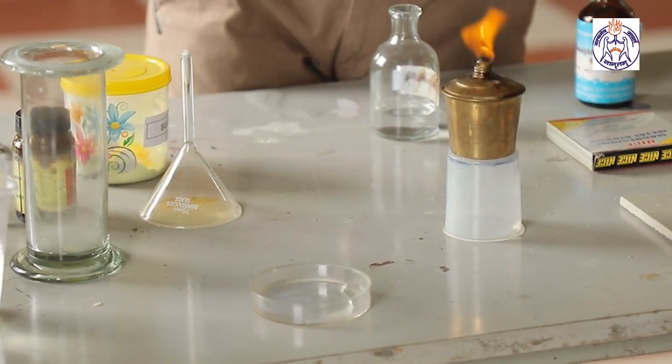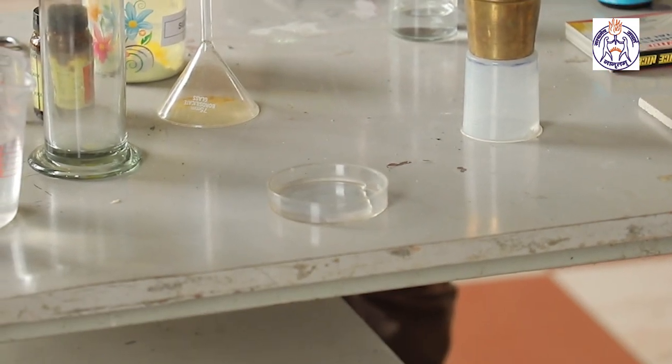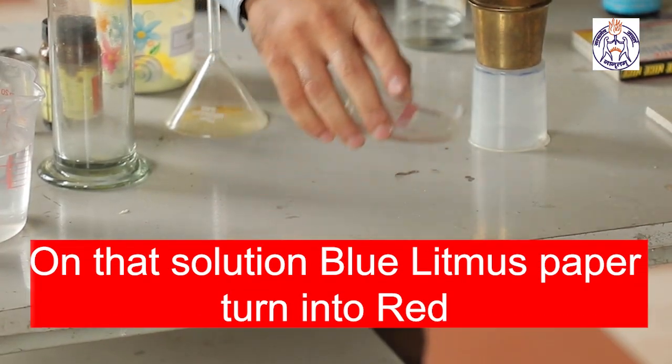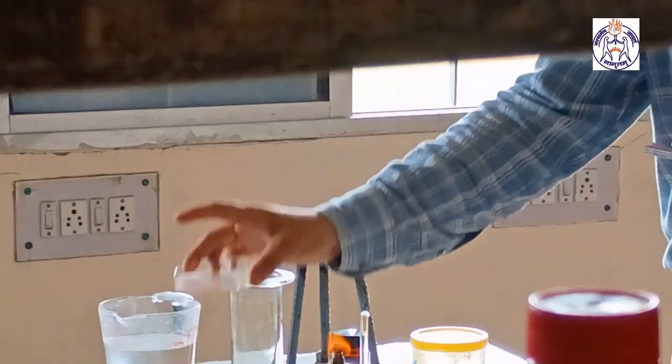I have blue litmus paper with me, and when I dip the blue litmus in that solution, the blue litmus changes into red.